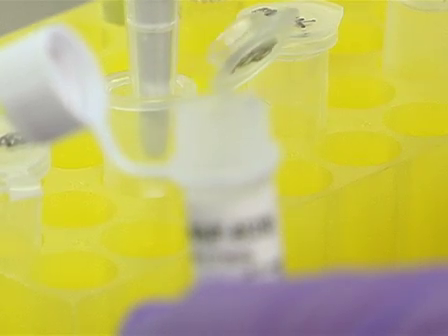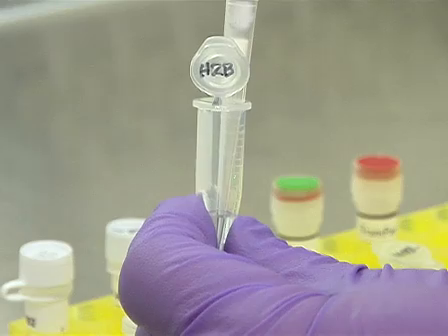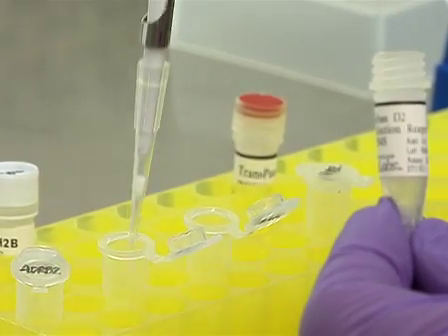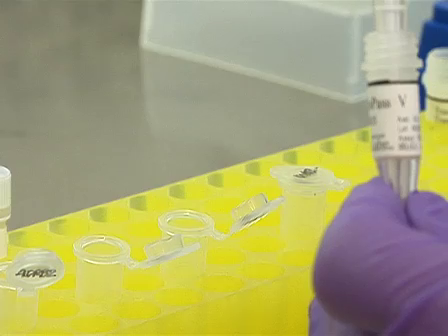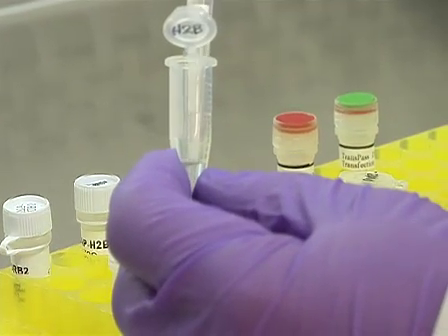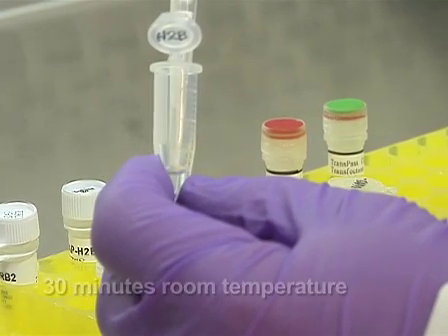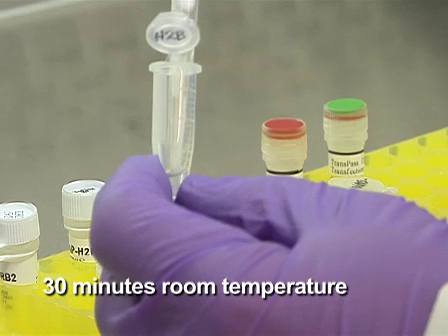For each complex mixture, first mix the serum-free DMEM with the appropriate plasmid DNA, then add the TransPass-D2 transfection reagent, followed by the TransPass-V transfection reagent. Mix the components well by pipetting up and down gently several times after the addition of each reagent and incubate the reactions at room temperature for 30 minutes.